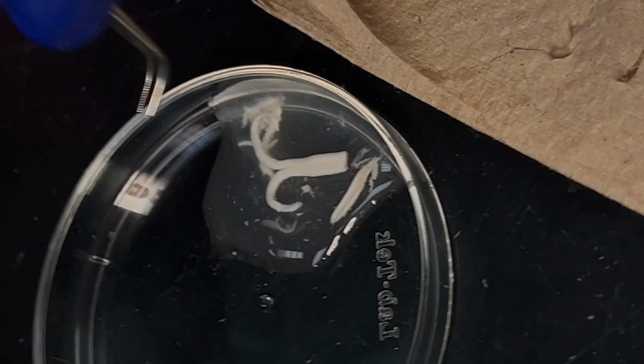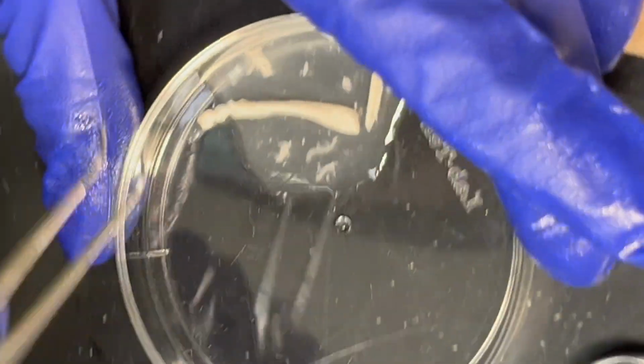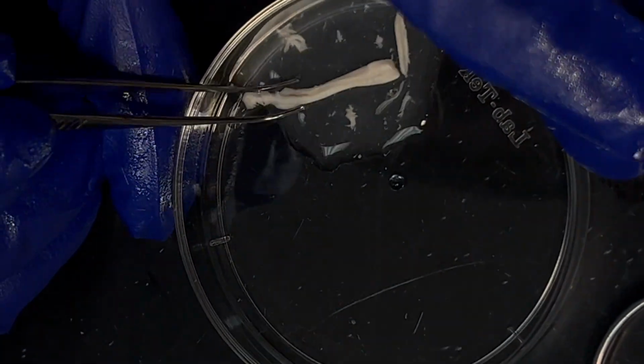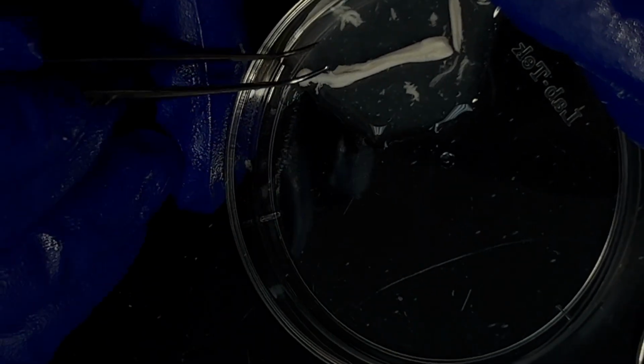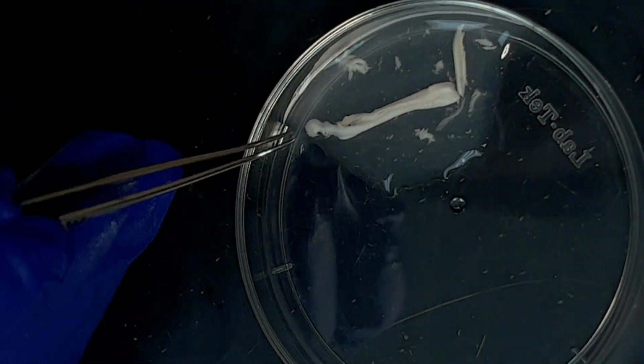This part is obviously, as you know, the cervical or upper part, because it's more thick, right? If I simply flip it, see, it kind of stitched down. Oh, that's so nice. Now it's not that bad. It's definitely better than last time, and it's split perfectly right in the middle. That happened because we cut a little too far.